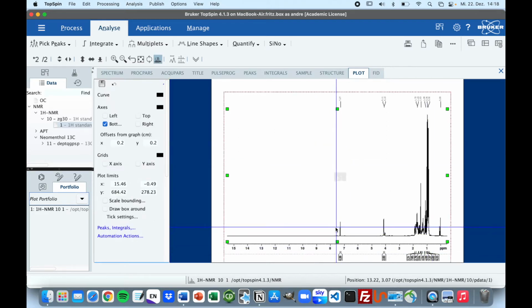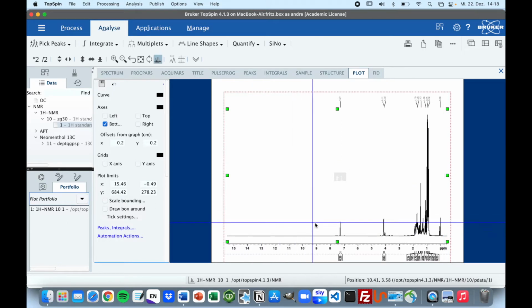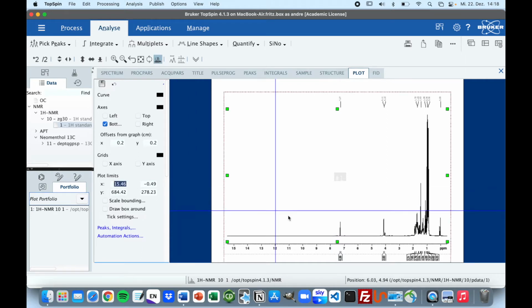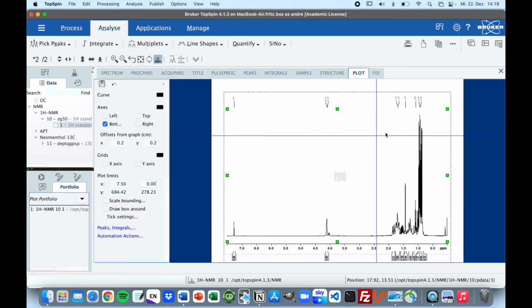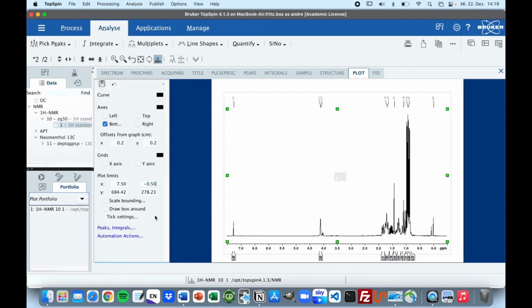The next step is to define an area for our spectrum. So as we can see, we don't have any peaks here, so we don't really need to export it. We will just change the plot limit to, well, let's say 7.5 ppm. So this is for our left limit. For our right limit, well, you could say we have our TMS signal at 0 ppm, but if we put this on 0, you can see that the peak picking isn't visible anymore. So it's good to expand the area a bit, so we will just go to minus 0.5.